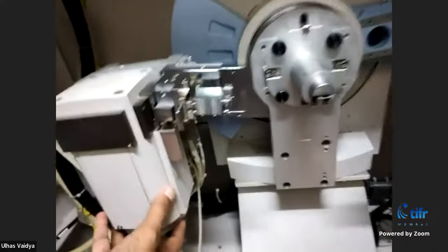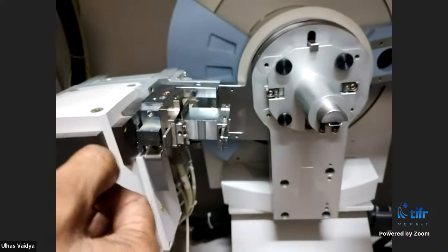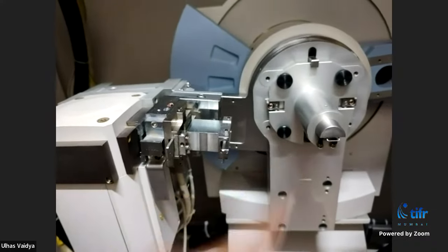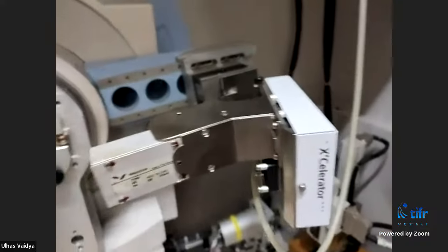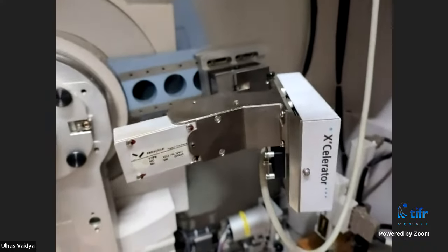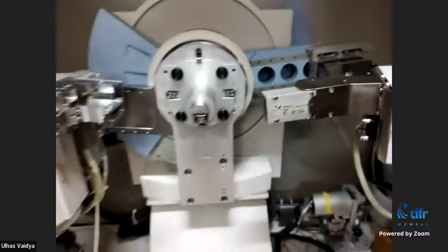This is the diffractometer where we mount the sample at the center. There is an X-ray tube generating X-rays. The X-ray beam comes through a beam conditioner which narrows it down, it falls on the sample, and there is a detector. When diffraction occurs, the diffracted X-ray intensity is collected in the detector and we get an X-ray peak.